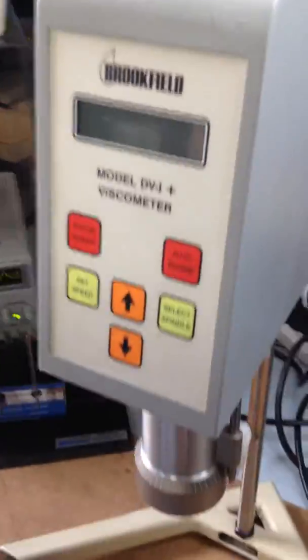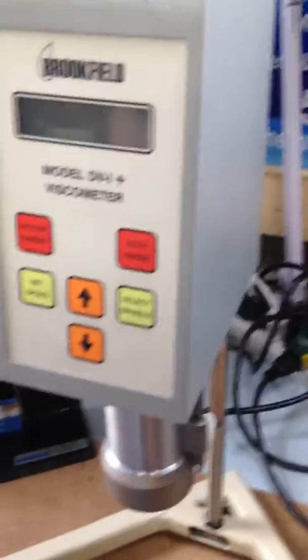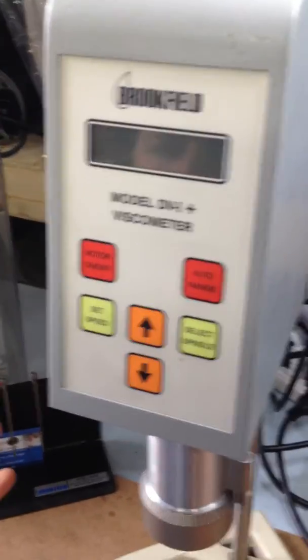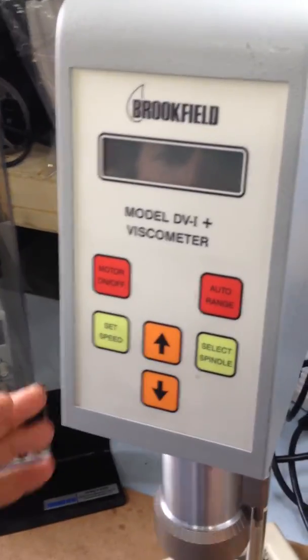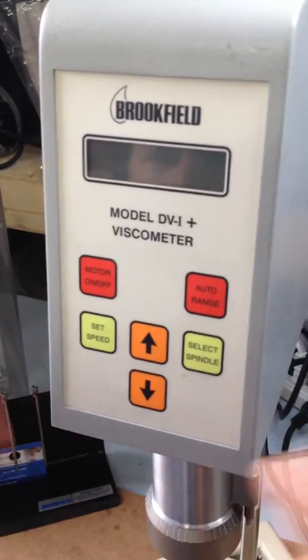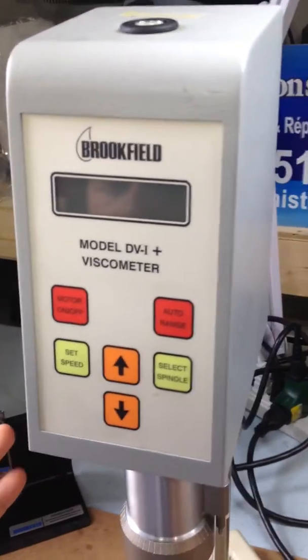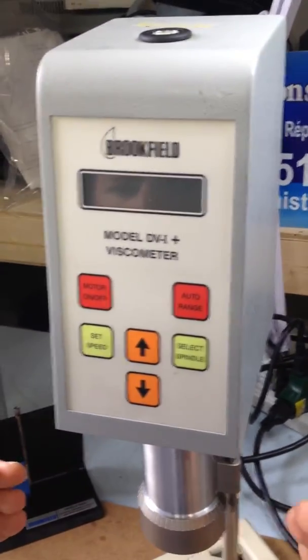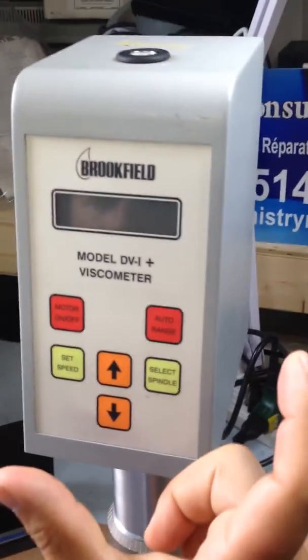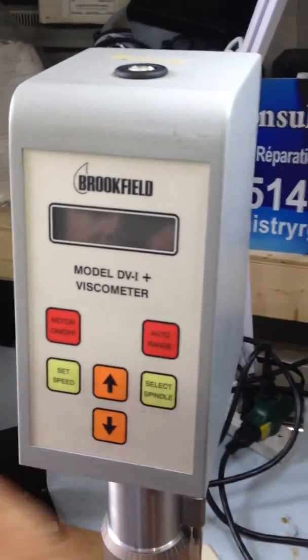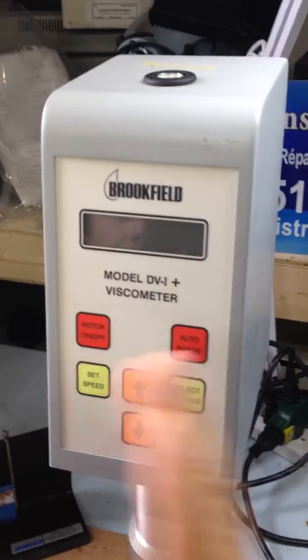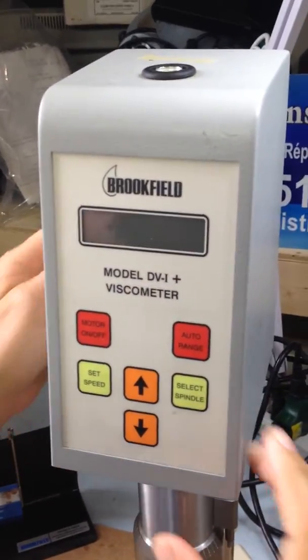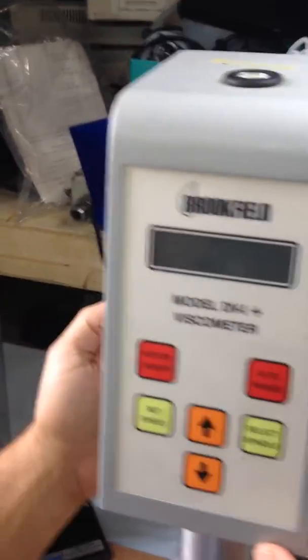Let's start. I'm going to show you what you have to do to get it done. This viscometer can measure different viscosities but just for yours we have calibrated for your range. It's going to go from 1000 to 4000, that's your range.